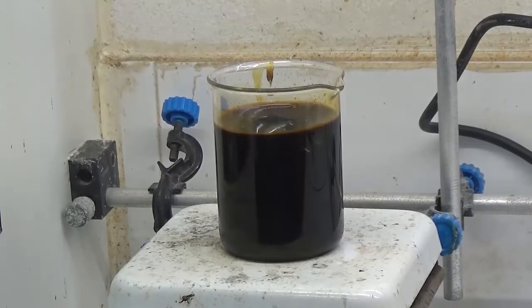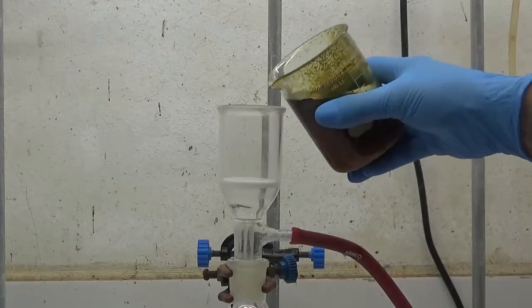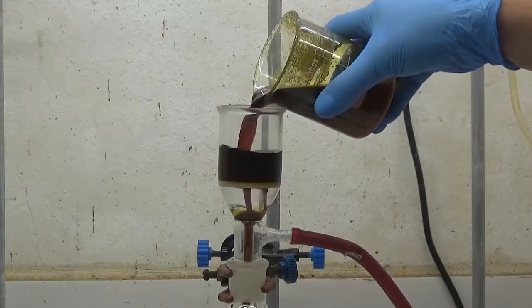Boil for 30 minutes and leave to cool. Collect the precipitate by vacuum.